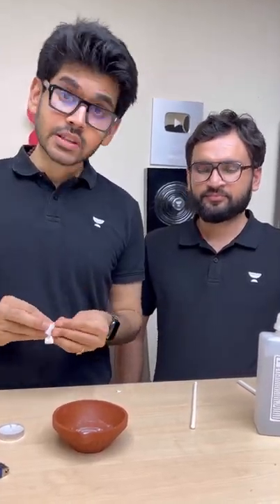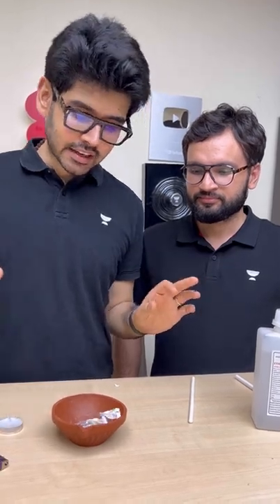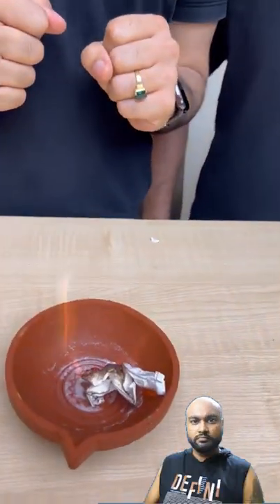And this flame is dangerous because this flame is not easily visible. The light is visible, but the flame itself is nearly invisible. Now you can see here — this is a paper. So be careful with this flame.